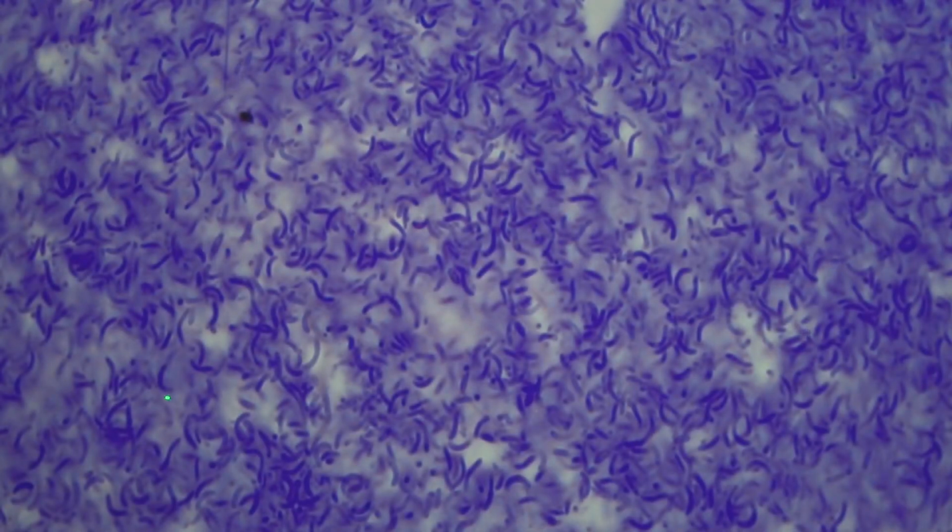Okay, so when we look at Rhodospirillum rubrum, that's pretty dense. That is a dense smear. You can see that the cells are longer than E. coli and they appear curved. If you grow Rhodospirillum rubrum out long enough, I'm just going to scoot it. Let's see if I can scoot it to the edge and find an area not quite as dense as the others. If you grow it for a long enough period of time, it actually forms the letter S. In fact, it can have multiple waves in it, not just two.